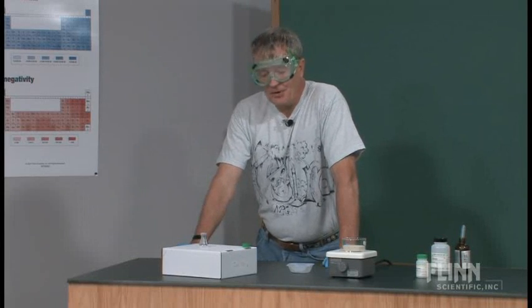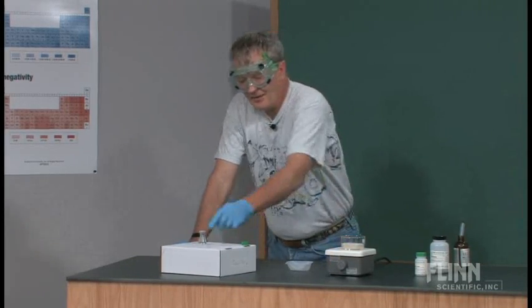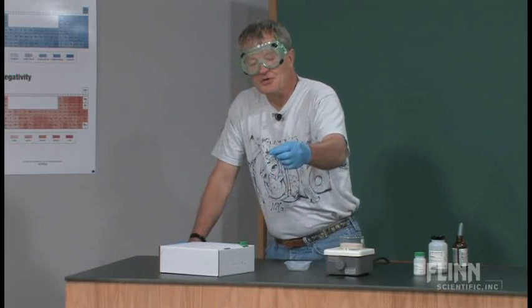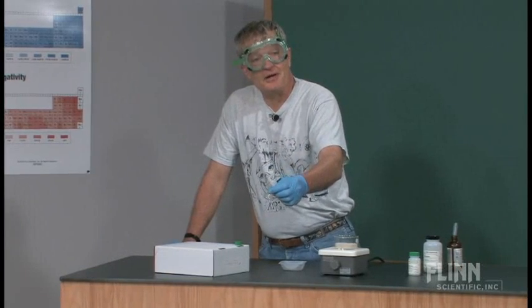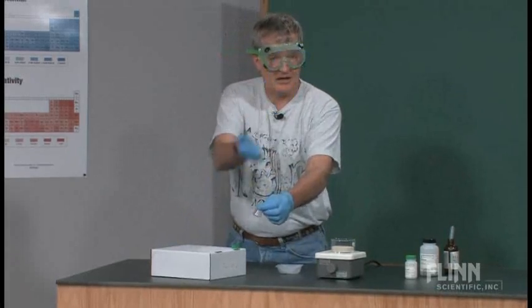The first time I did it, I told them to evaporate it over a Bunsen burner inside a fume hood, because now you're going to drive off the HCl for sure. So that part really needs to be done inside a fume hood or a well-ventilated area.